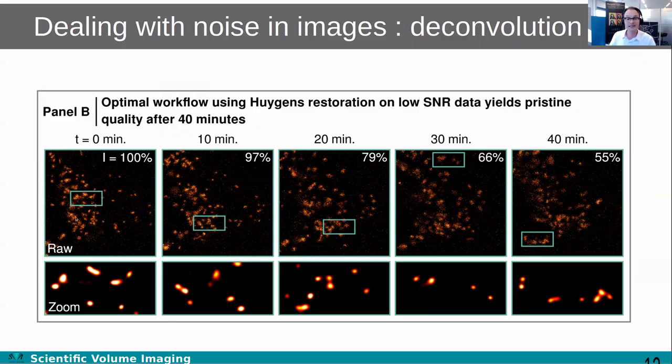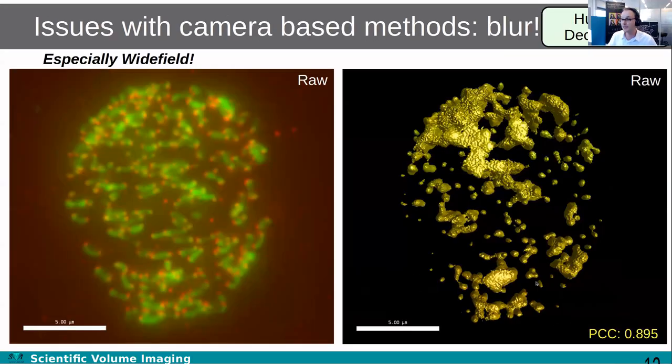Here we dramatically decrease the amount of irradiance that we use, so lower integration times, lower laser intensities. As you can see, over the course of tens of minutes, the intensity just drops very slowly. And each time, using deconvolution, we can get a very high SNR deconvolved result out of that. So if you have noisy data, deconvolution is a great counter.